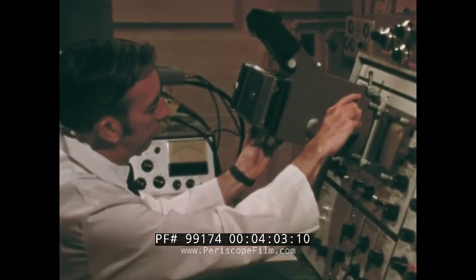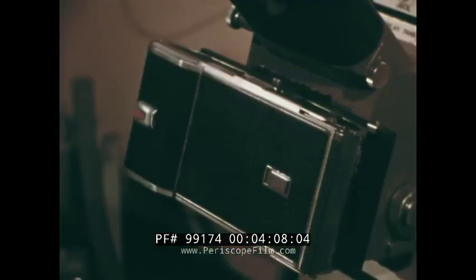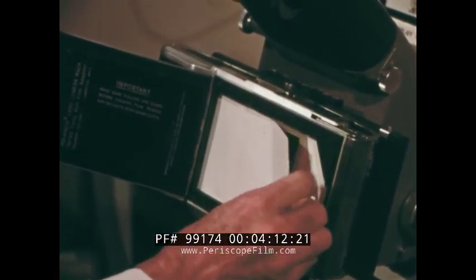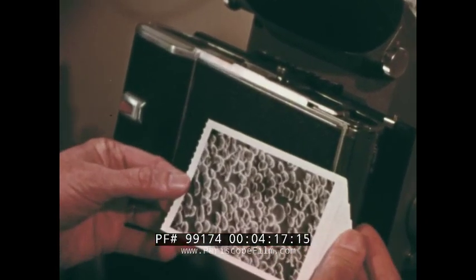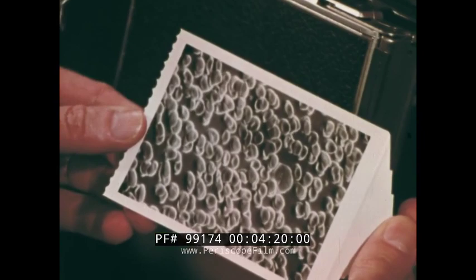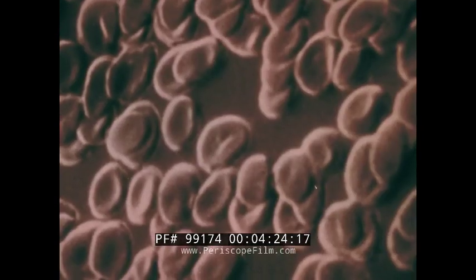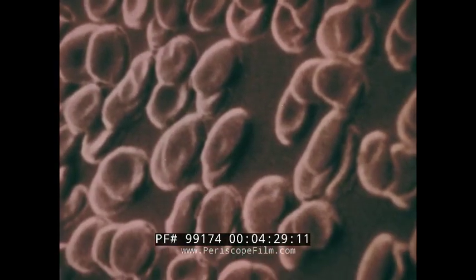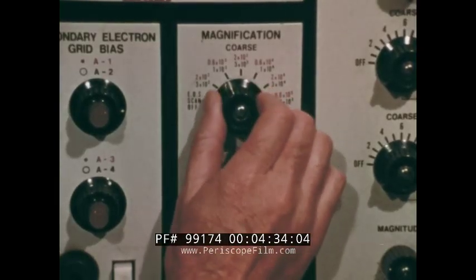As with any microscope, what we see can be photographed and recorded. We feel we're in contact with the real thing because we see form as we are accustomed to see form, in the familiar parameters of size, shape, texture, and depth. If greater magnification is needed, one has only to turn a knob up to a limit.